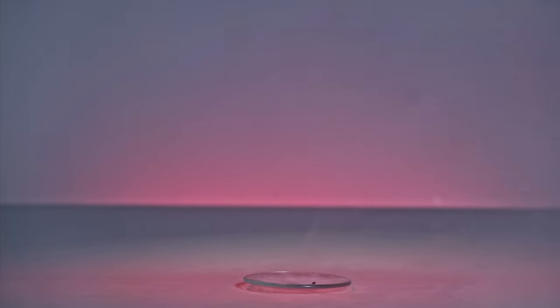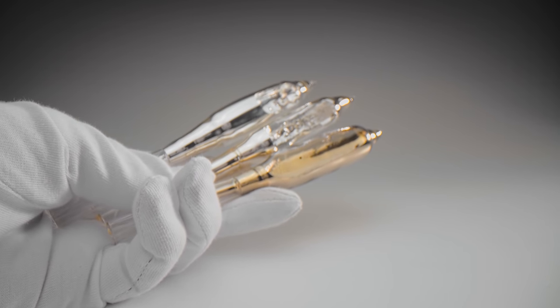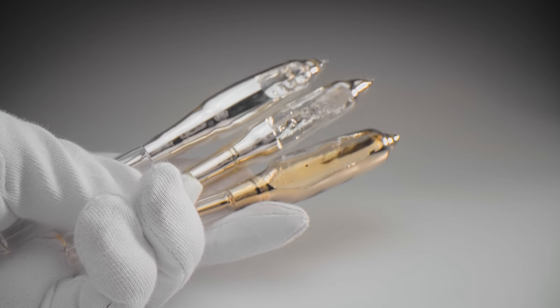As you understand, this alloy is very similar in properties to the rubidium-cesium alloy, but I decided to make these videos anyway to showcase the most fusible alloy in the world. I hope you enjoyed it.